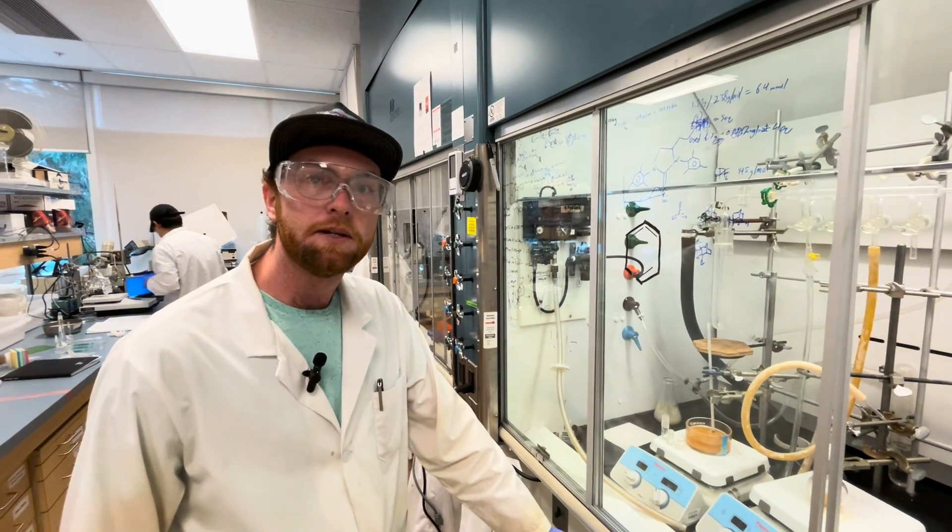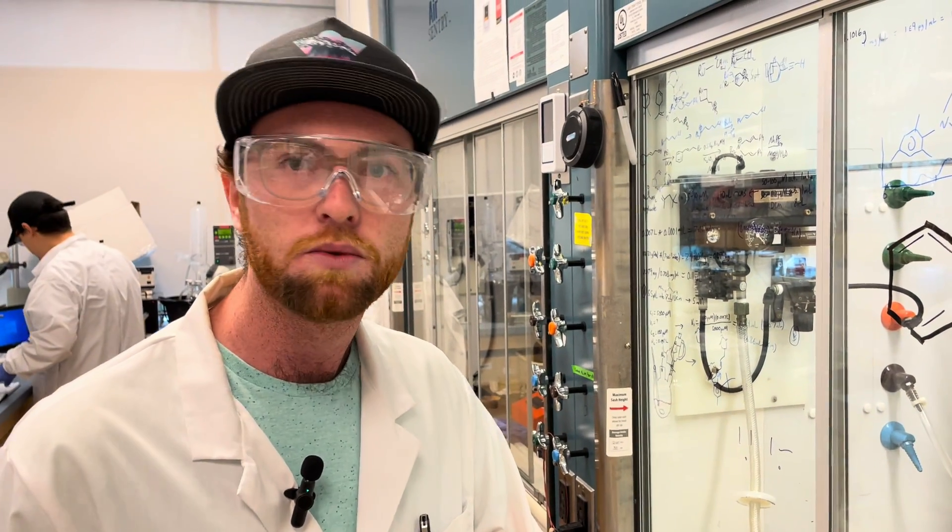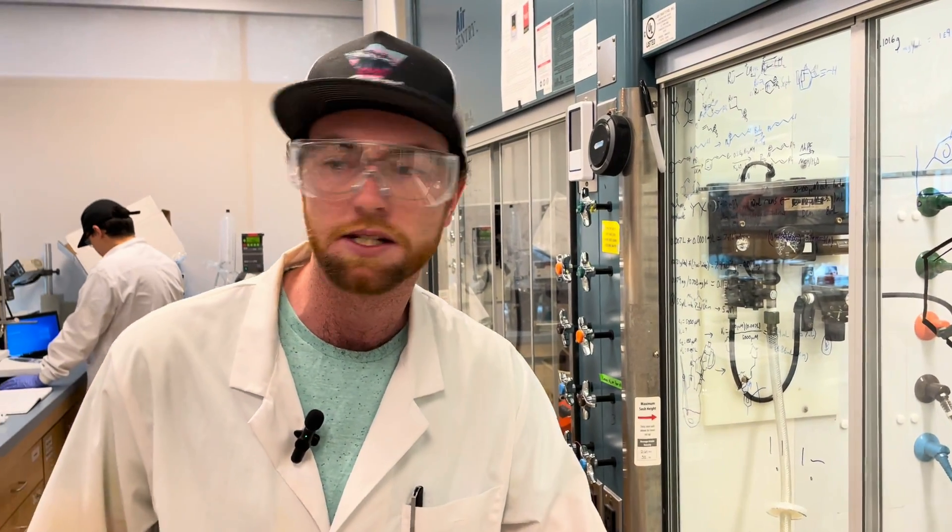Hello everyone, my name is Charlie. I'm a third year PhD student in the McIndoe lab and today what I'm going to demonstrate for you is the correct way to peroxide test organic solvents.